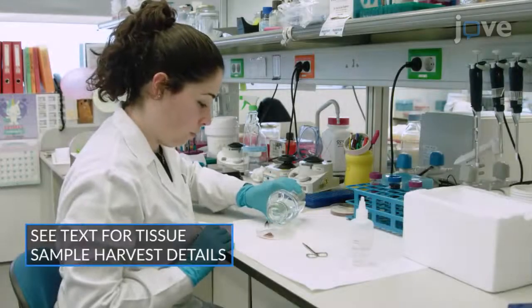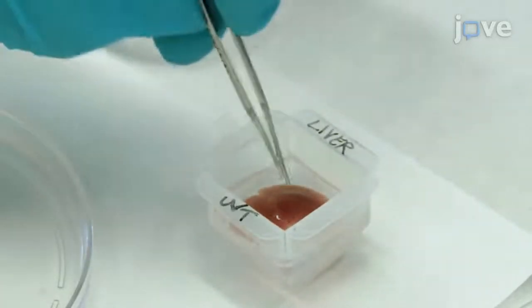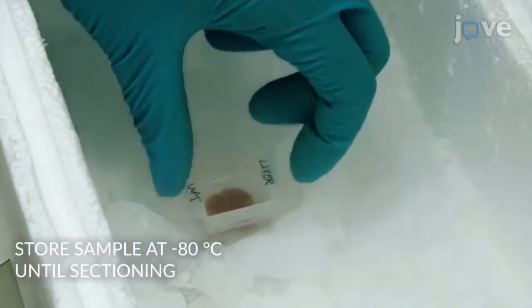After harvesting the murine liver tissue sample, embed the liver lobule into an optimal cutting temperature medium-filled cryomold and immediately place the mold on dry ice to ensure rapid freezing.